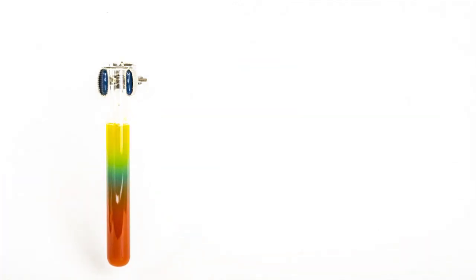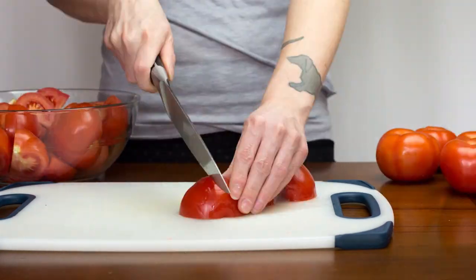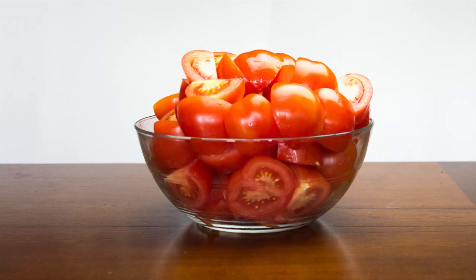This spectacle in a test tube began with tomato juice and is called the tomato juice rainbow. How did we create this fantastic rainbow using tomatoes? Keep watching!